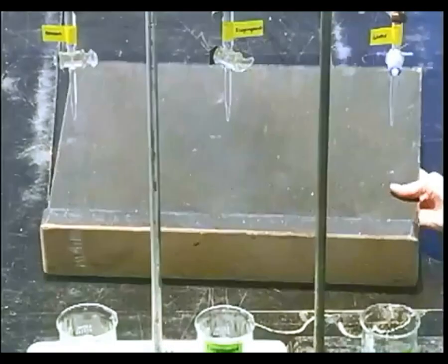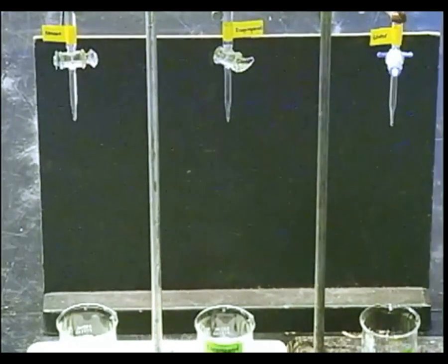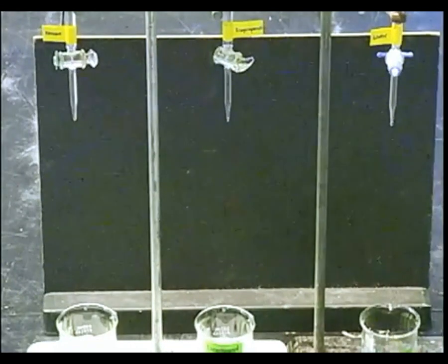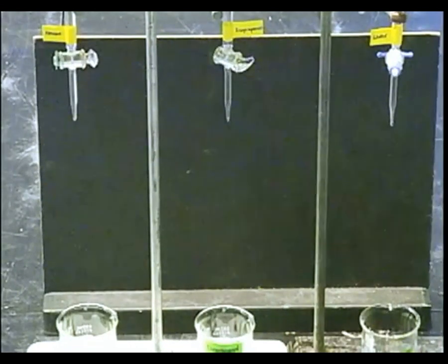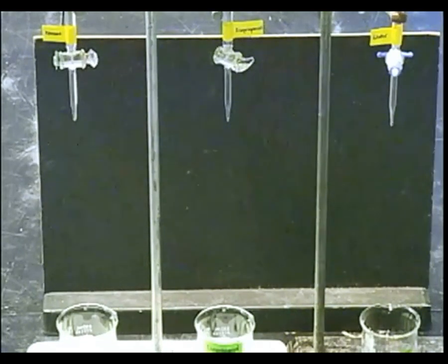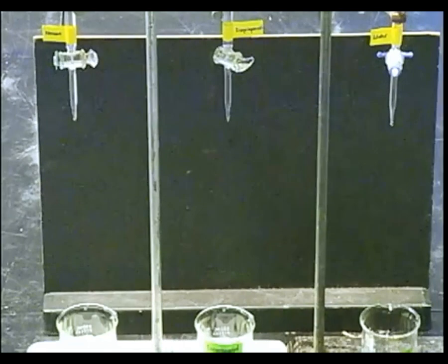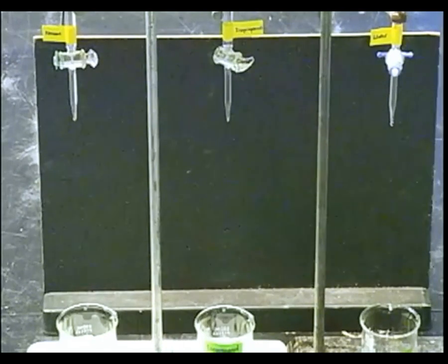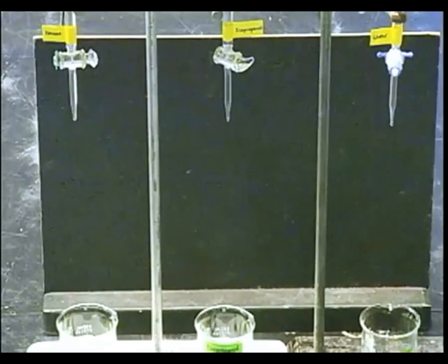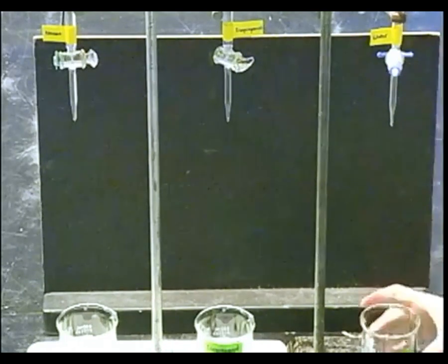Now what I want to show is a charged wand demonstration. There are three burettes filled with different molecules. The first one is hexane, the second one is isopropanol, and the third one is water. What I'm going to do is take a charged wand by using cat fur — you can also use wool or silk. We're going to put the wand up to the liquid and see if the liquid is attracted towards the charge or not.